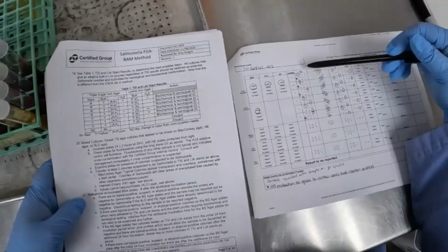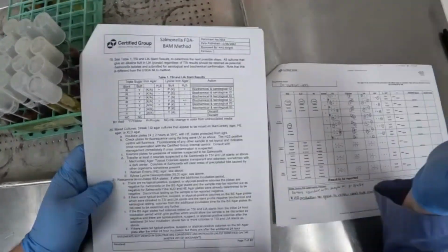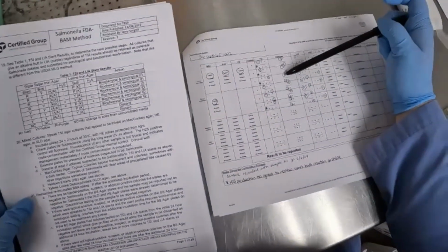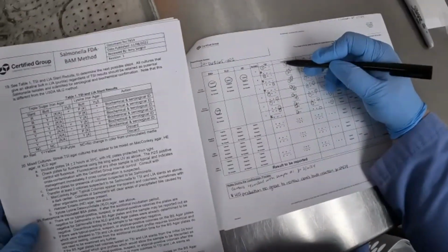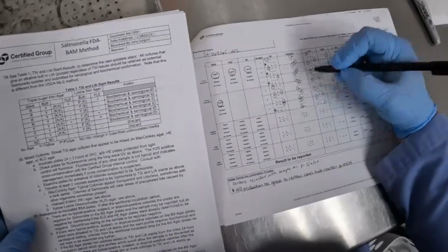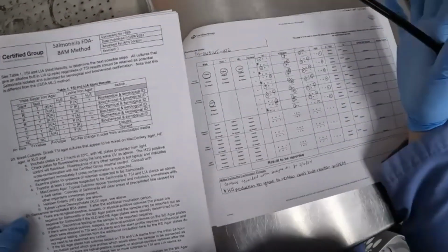So for sample 2, once again, we saw a lot of H2S production. And once again, that's the first thing you're going to look for. Anything with H2S production automatically gets moved through. So isolates A, B, C, and F automatically get carried on. H2S production for A was yes, B was yes, C was yes, D was no, so we can take a look at that one. E was no, so we can take a look at that one. And then F was yes. So automatically A, B, C, and F get carried on.